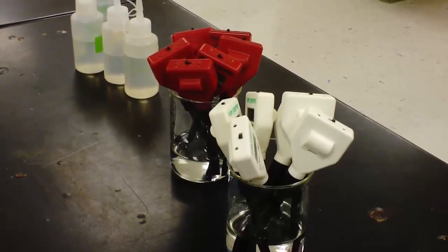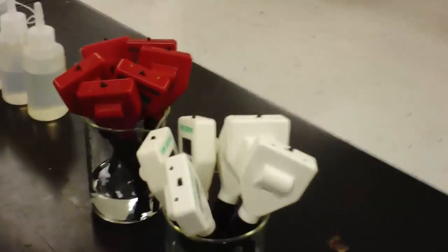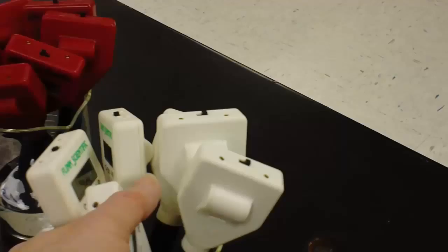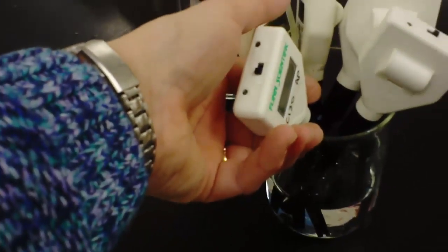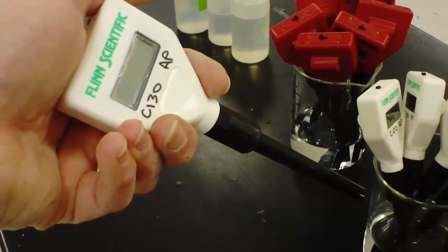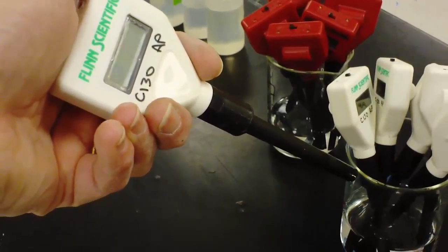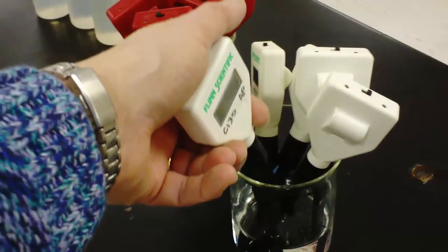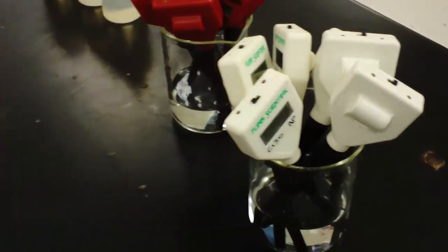If it is, then take it out carefully. Hold it in between your index and your third finger. So you're going to grip it like this. Give it a shake to get rid of the excess liquid, and then take it to your lab station and set it up as you saw previously.